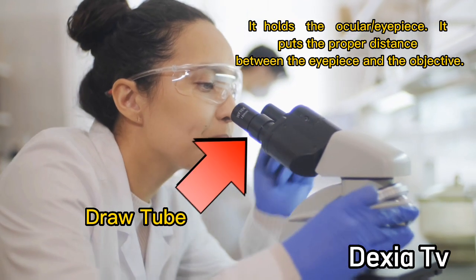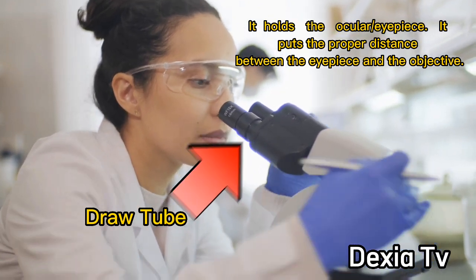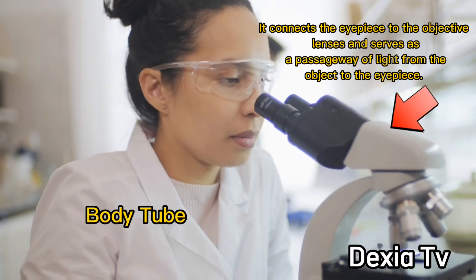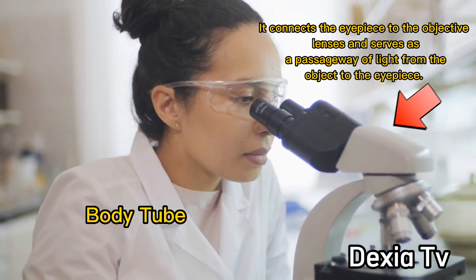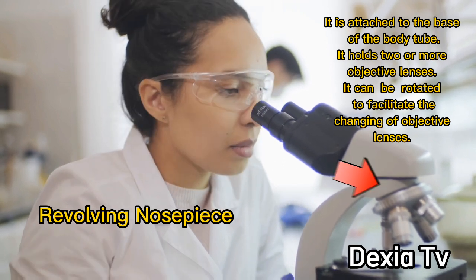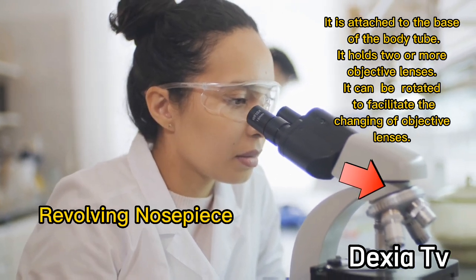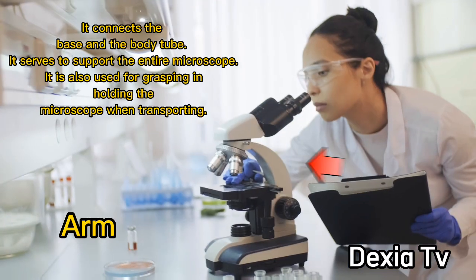Draw tube: It holds the ocular or the eyepiece. Body tube: It connects the eyepiece to the objective lenses. Revolving nosepiece: It is attached to the base of the body tube.